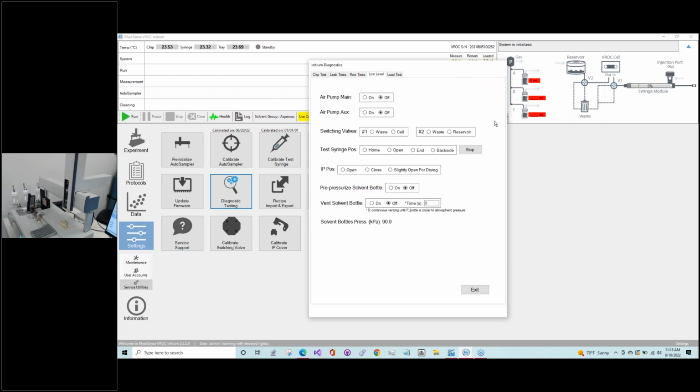We'll go to what's referred to as the low level tab. So a couple things I want to point out. One is that, just to get comfortable when you're troubleshooting, even if things are okay now, to get some sort of baseline if you're ever troubleshooting switch valves, it's probably beneficial to force them to switch, both valves one and two, just so you can hear what a healthy, functional switch valve sounds like. So if one of your flow tests, for example, fails and you suspect maybe one of the switch valves isn't switching properly or it's clogged, you can go here and force it to switch. And oftentimes this is a good clear indicator that something has gone wrong and it's really time to replace those.